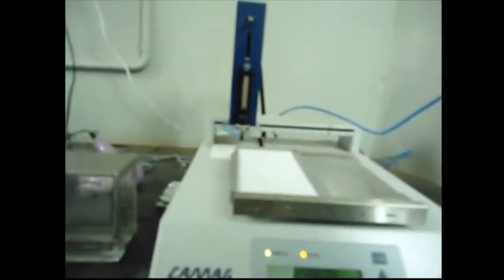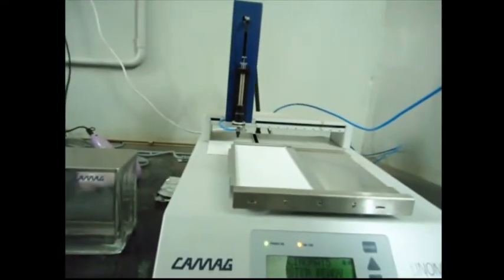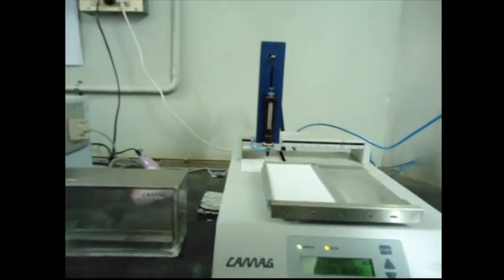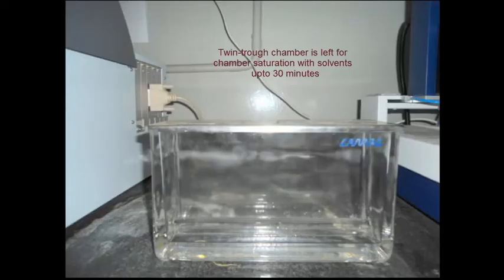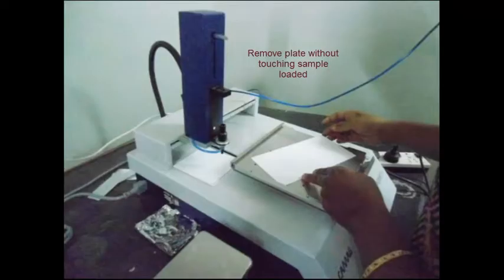After it comes to the port position, remove the syringe. Remove the chromatography plate without touching the sample.